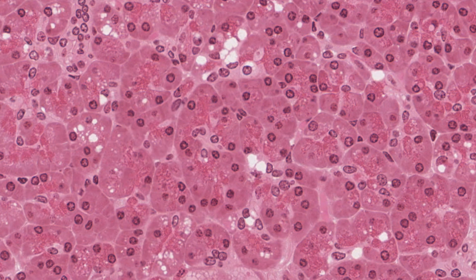This is where the rough or granular endoplasmic reticulum of the cell and numerous ribosomes are located. The upper half of the cell is packed with eosinophilic secretory granules. Where the preservation is good, the granules are visible as eosinophilic dots in the tops of the cells. The main function of these acinar cells is to synthesize and secrete digestive enzymes for the small intestine.